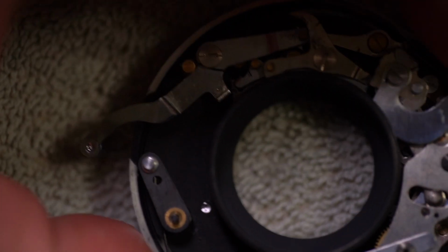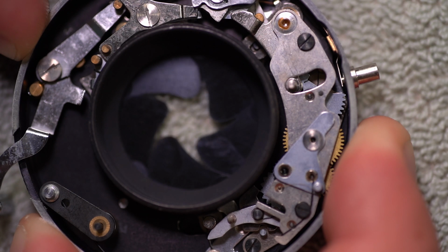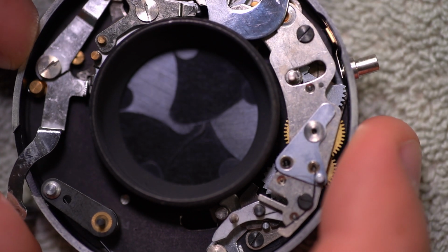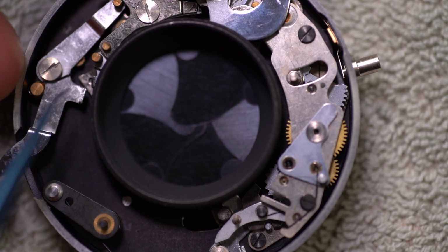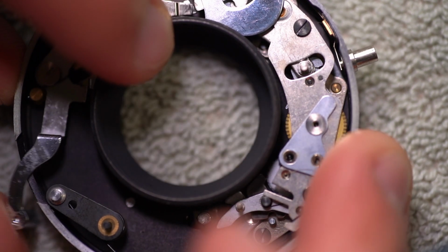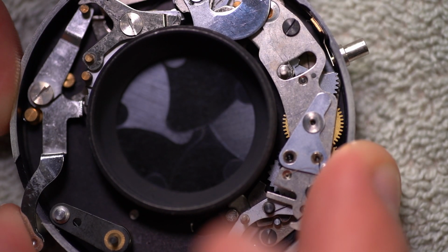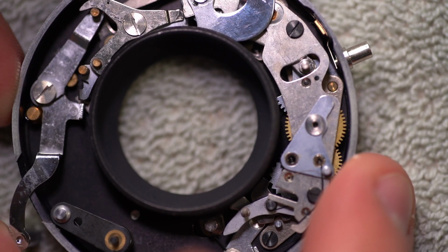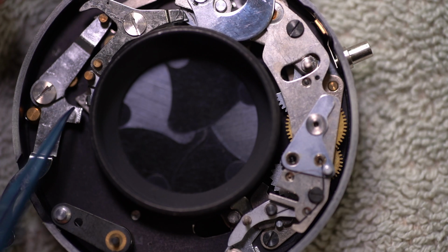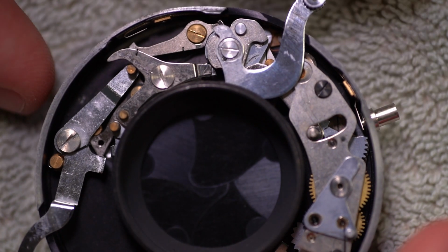But I just wanted to show you how complex this is. I looked at this, I was like, you've got to be kidding me. I mean, that is a joy to watch work. I mean, that's just cool. And there it goes, and there it goes again. I think if you watch this, yeah. So there's some sort of springy system that goes in there, and this is what actuates the first part of it. Okay, so watching this piece here.